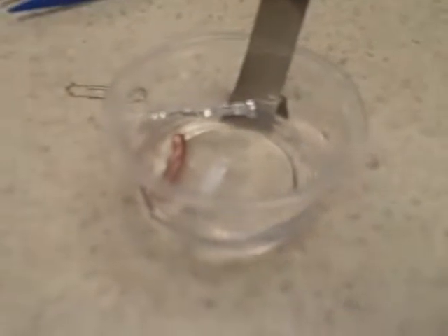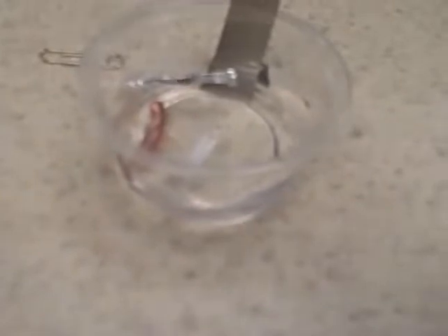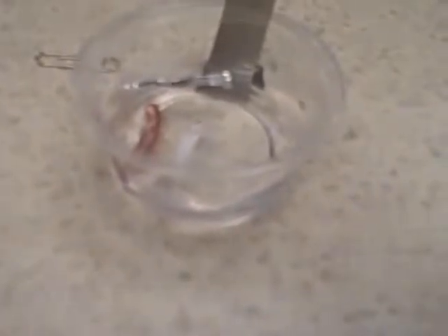Are you getting any bubbling at all from any of the samples? Yes. Okay, rate them from 0 to 10, I beg your pardon. With 10, the calcium that you saw was a 10, because it was reacting in just water.